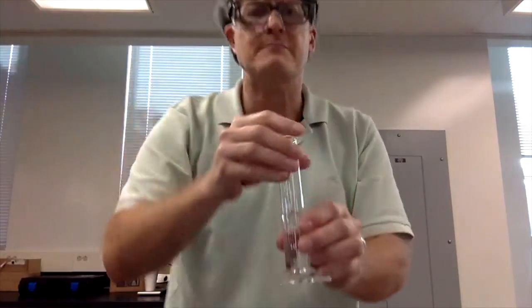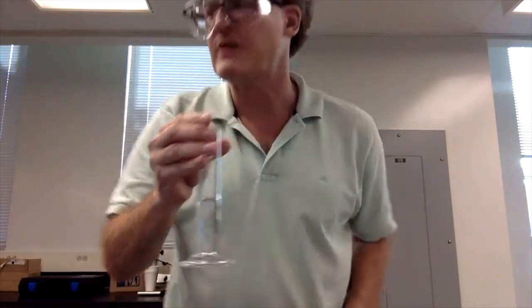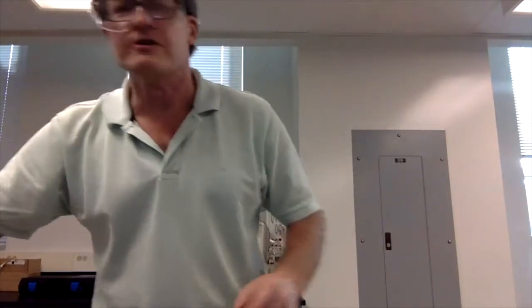So we'll keep that there. We're going to be really careful about making up solutions. When we look at the directions there, we see we need about 30 mLs of solution in a graduated cylinder. And we're going to be switching these things around. We're going to make up 5 dilutions for each one, KCl and acetic acid, right?